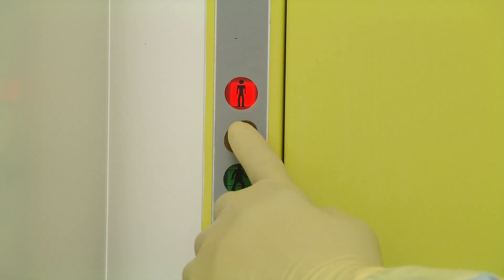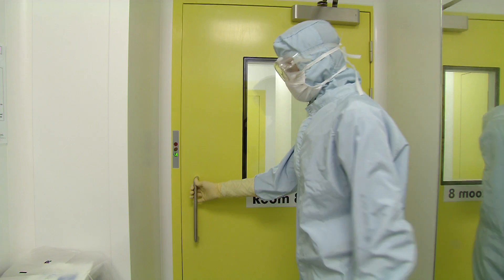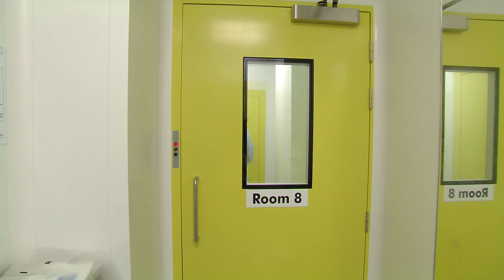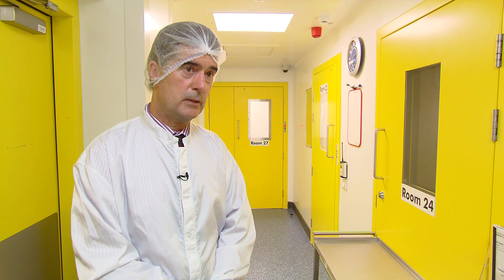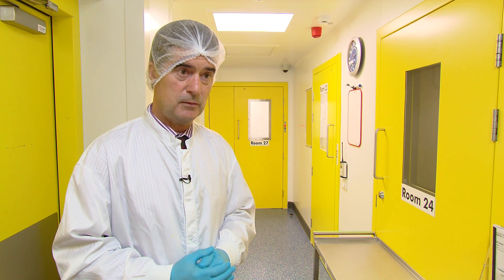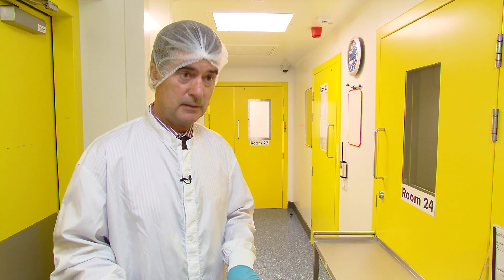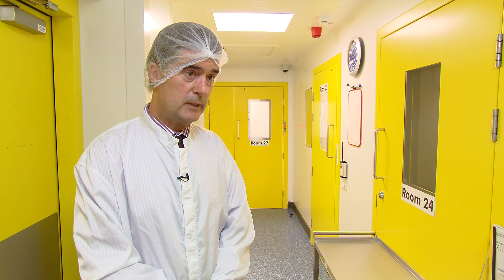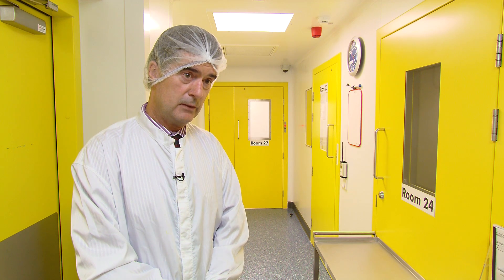In this facility, we expand or manufacture stem cells, which have to be sterile for injection into the patient. There's a team of eight people: a production manager with stem cell technologists reporting into them, and a quality manager who oversees quality technicians who carry out environmental monitoring to show that bacterial levels and particulate levels are within criteria. There are also contract cleaners who disinfect the area every evening, and an engineering person who maintains the air handling facility supplying filtered air to the clean rooms.